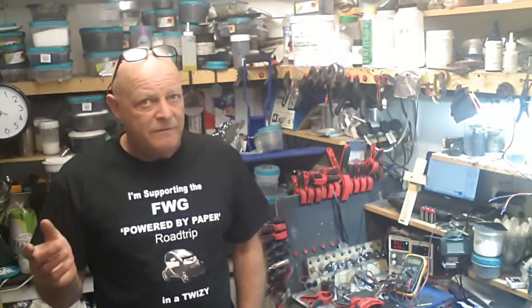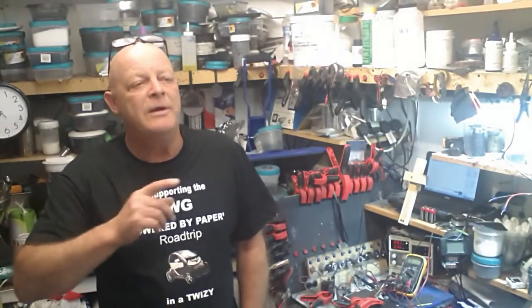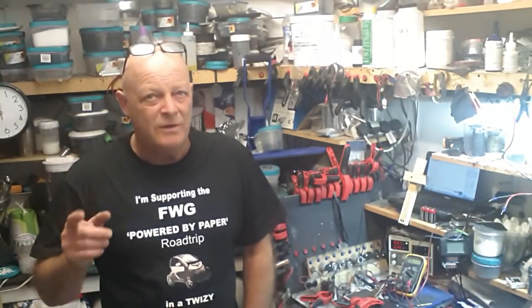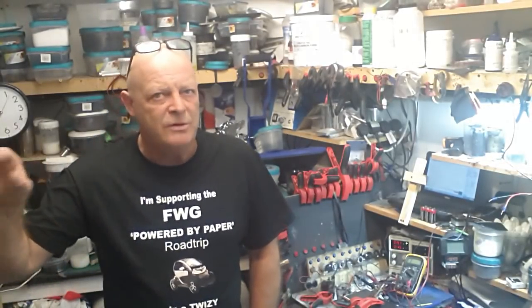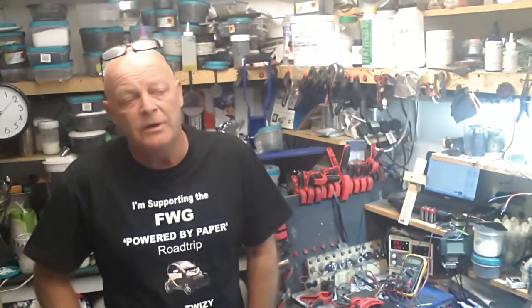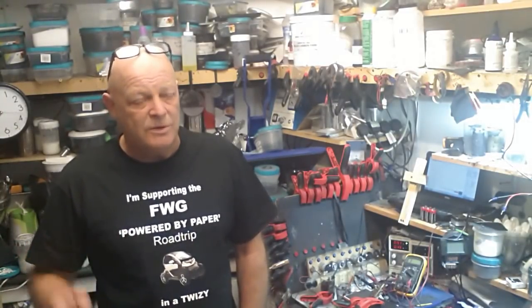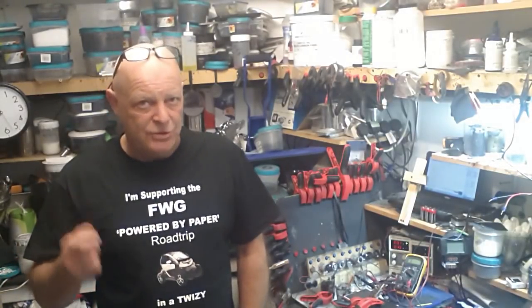Without further ado, one thing to remember throughout this reaction is that what remains is a plus seven oxidation state throughout. If you look at the chemistry of it — look it up on Wikipedia or Google Scholar — and look at the reaction, you'll see what I mean. So what I'm going to do is move the camera and just do a little demonstration and show you what can go wrong.